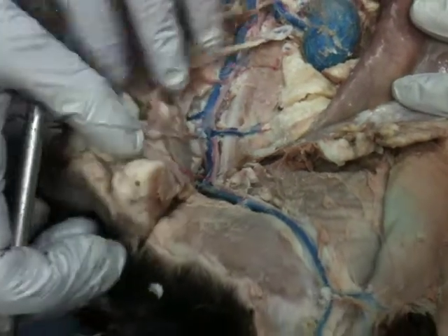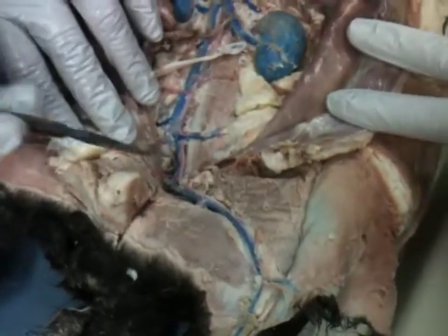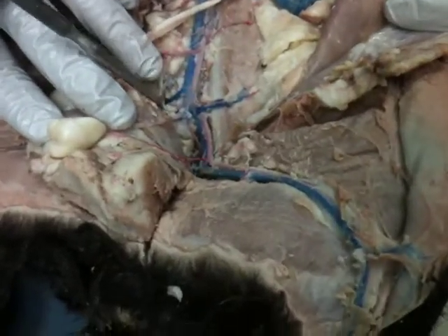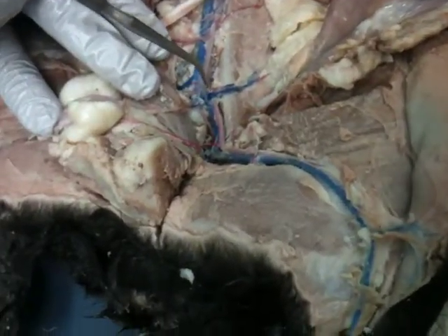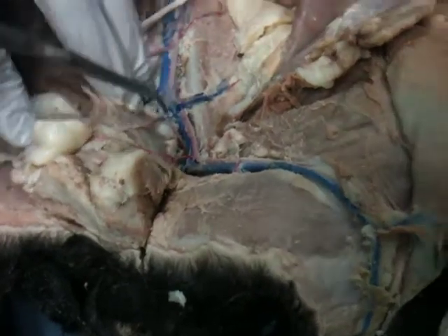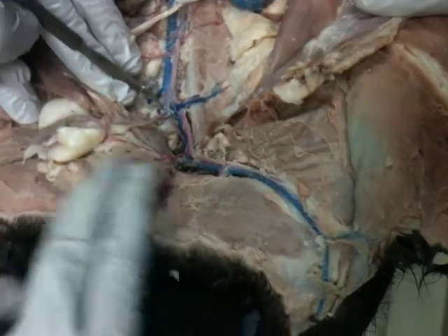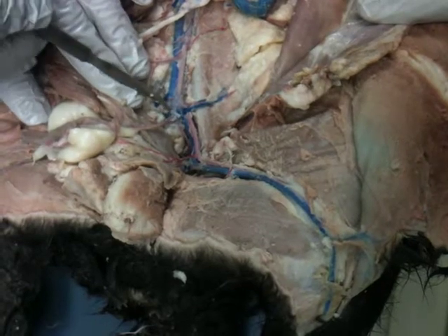Okay. This cat does not show this iliac area as clearly as I have seen it in other cats, but I'll walk you through it on here. Basically, you're looking for two upside down Ys that are here. So the first division, and this is different in the cat than it is in the human, we'll have our external iliac artery. There'll be a little piece that goes down, and then it will again divide, and down there it's called the internal iliac artery, like right down here is the internal iliac artery. So external, internal iliac artery.